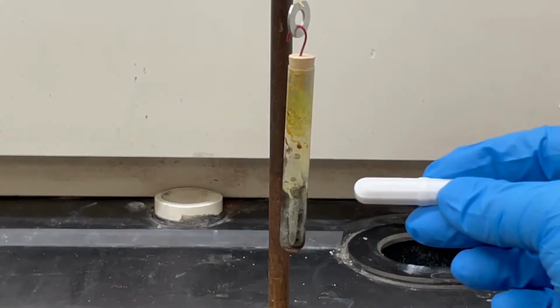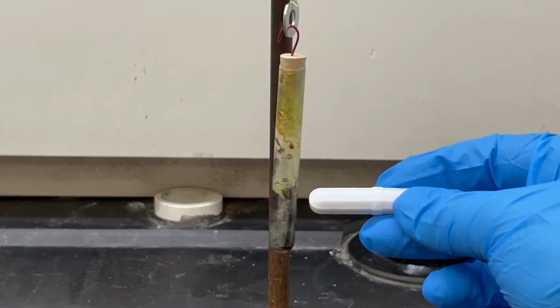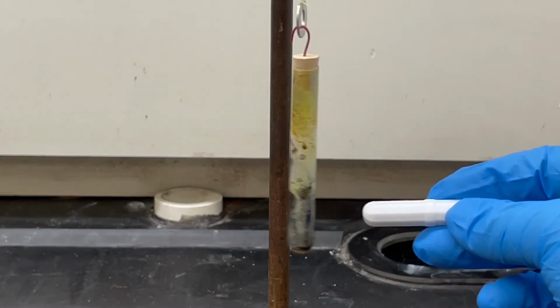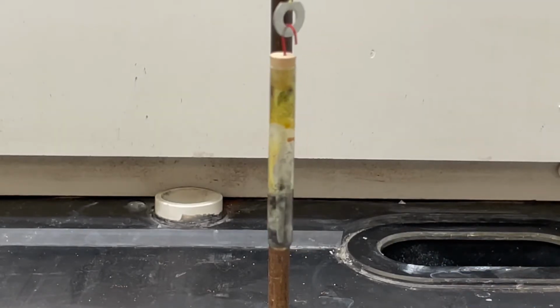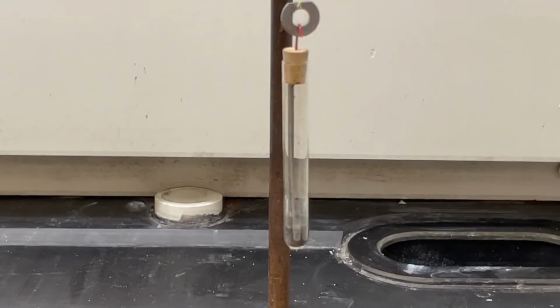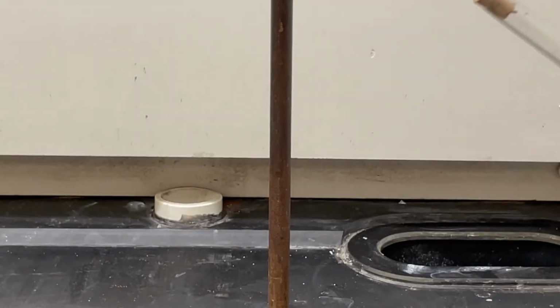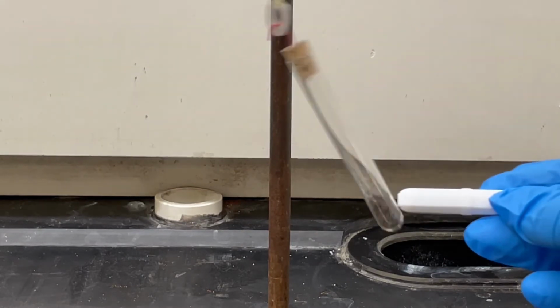After the reaction, I test the product's response to a magnet. We see that it is only weakly attracted to the magnet, telling us that the iron powder has been chemically transformed into a new compound containing both iron and sulfur elements. Comparing the iron sulfide to pure iron, we see just how much weaker the magnetic response has become.